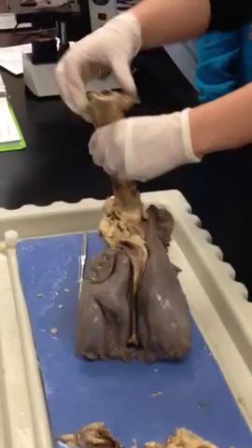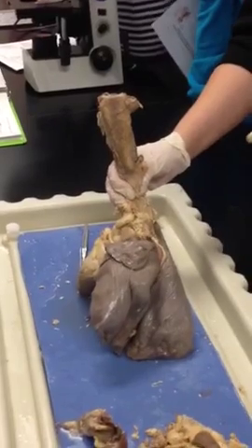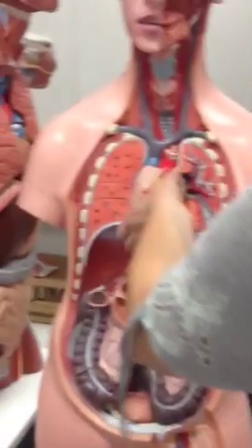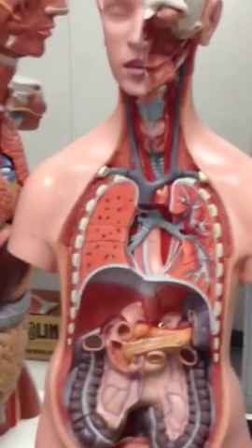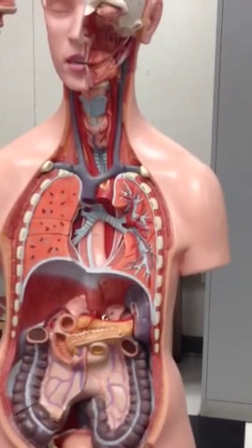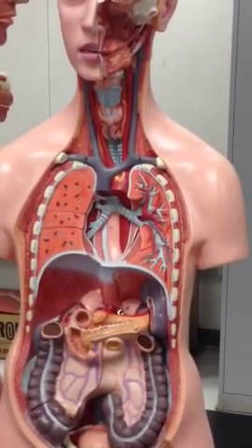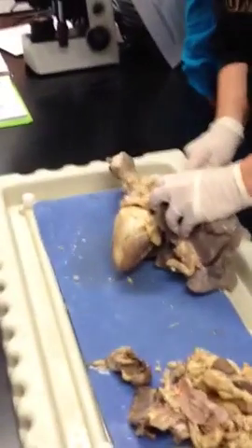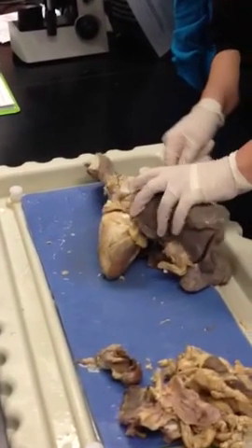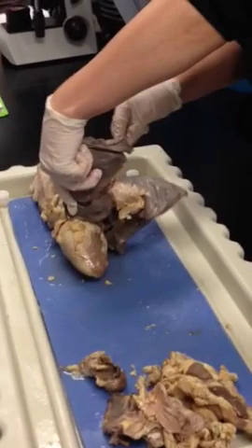So you have your trachea that comes down and then branches off into the bronchi. So will you remove the lungs there and the heart? Alright, so you see how your trachea comes down and it branches off to the left and the right? Yes, the light blue, you see, with the cartilage in it? Oh, yeah. So the primary bronchi, right? Those are your primary bronchi. So when we go to cut off the lungs, you should be cutting through your primary bronchi.